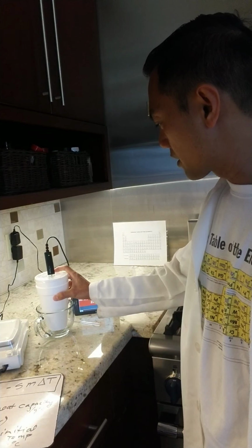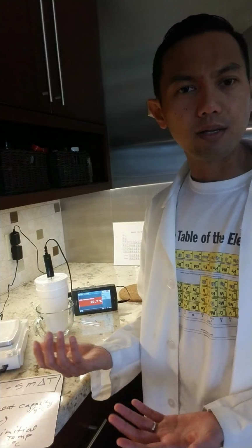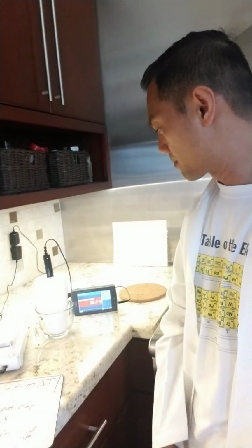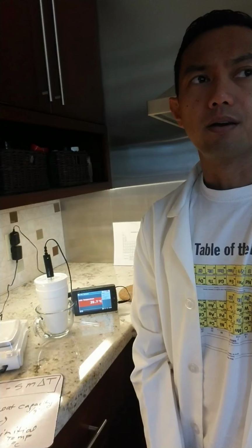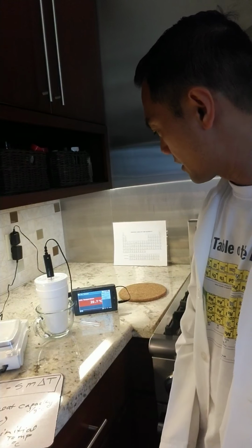I'm going to swirl our calorimeter, or they call it a bomb calorimeter, like the official calorimeters. It's usually made of metal, but since we're improvising, and even in our lab we would have done something similar, we would have used these styrofoam cups, double styrofoam cups. We're now at 20.7 degrees Celsius. Since our setup is like this, you have to consider as part of the error analysis when you're writing the lab report that this is not exactly the most accurate and precise way of doing this experiment. We're at 20.7 still. This is our metal B. I'm going to give it some time.